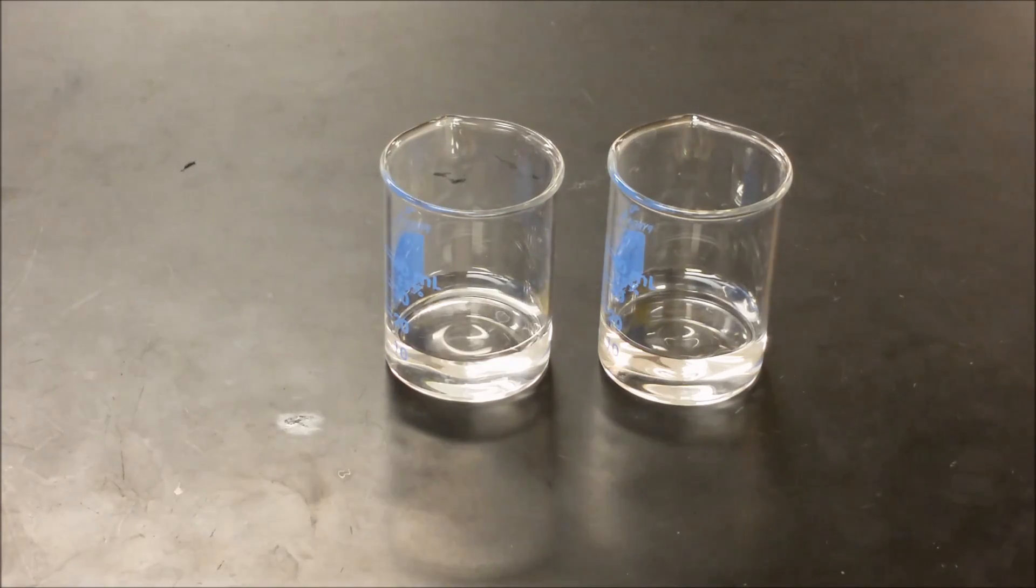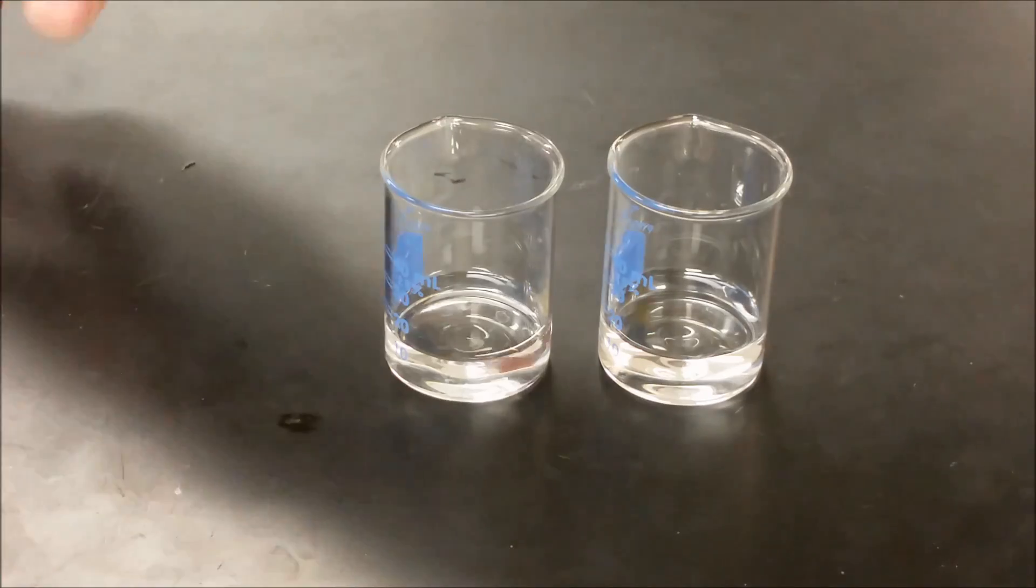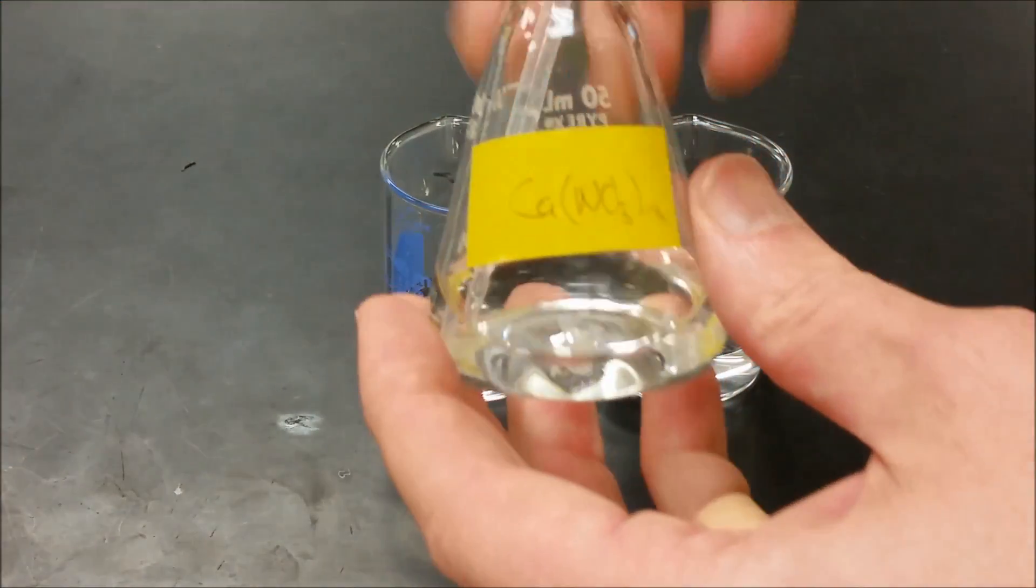We've got two containers with distilled water and we're going to put some calcium nitrate into both.